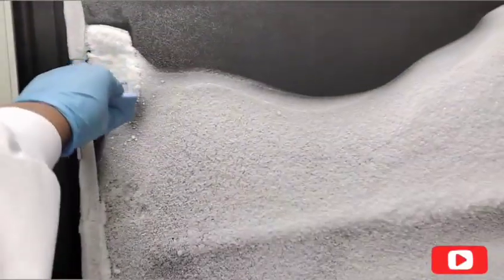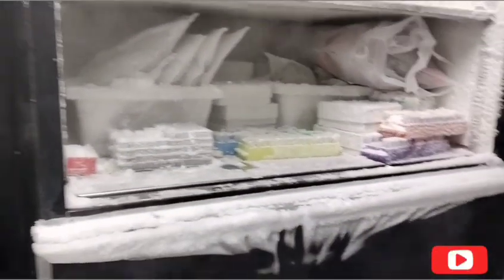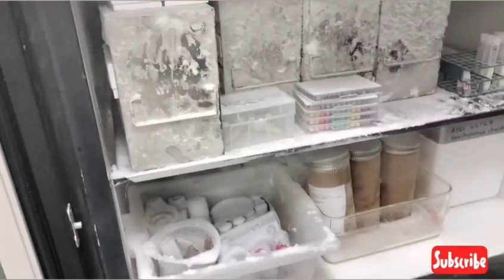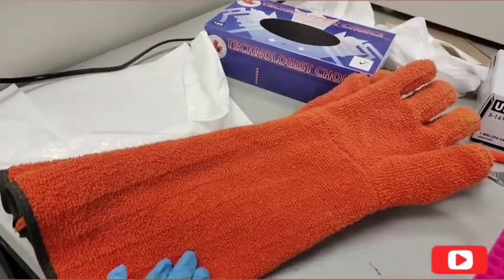Ooh, okay. It's not as frosty as I was expecting it to be. Oh, okay. It's not up there. Maybe it's down at the bottom. All right, so I'm going to put on some freezer gloves and grab that.